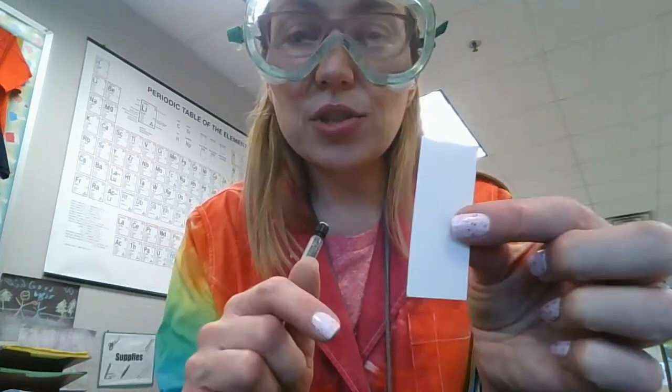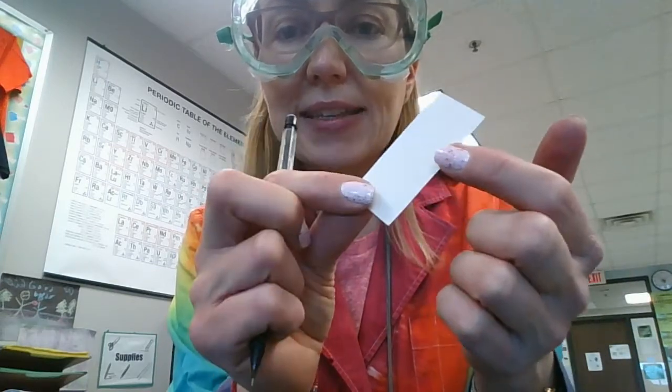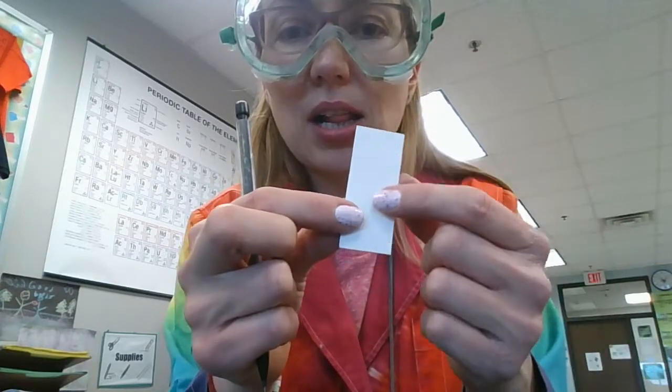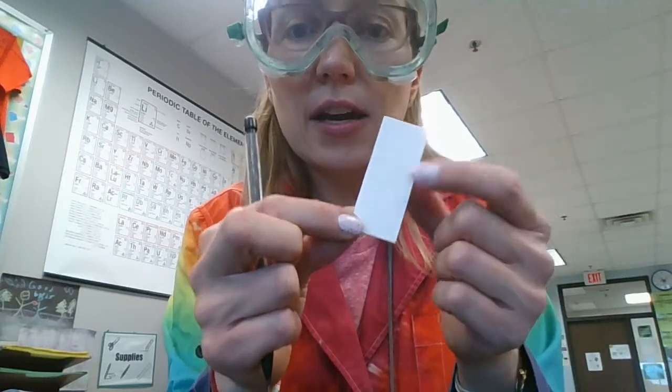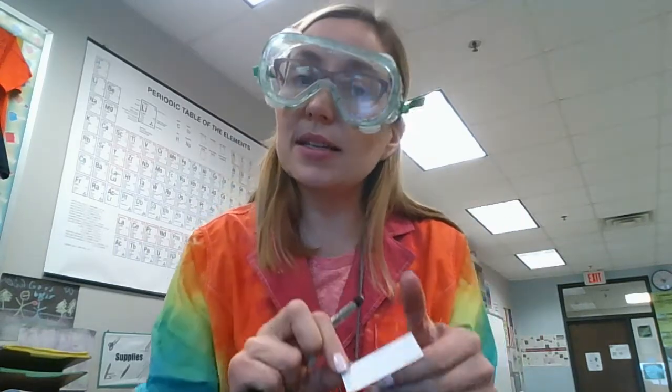Now I should say that there are two sides to this plate. There's a shiny plastic side, that's the backing, that's the back side of the plate. The dull side is the silica side of the plate and that's really delicate, so you can scratch off that silica really easily. When you're using these mechanical pencils, you have to be really light about it.